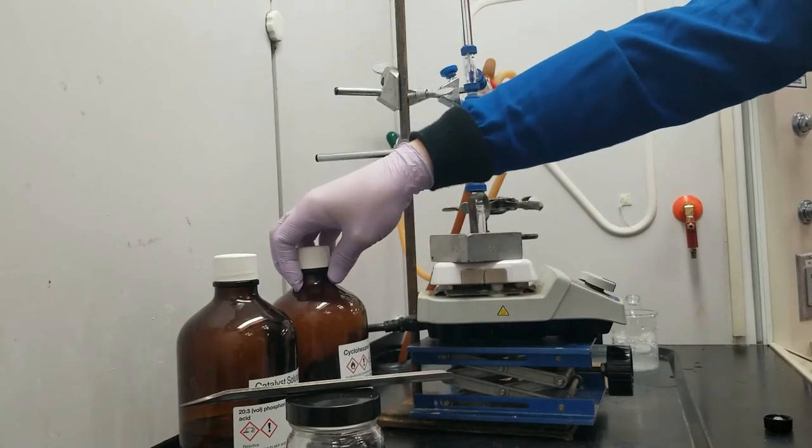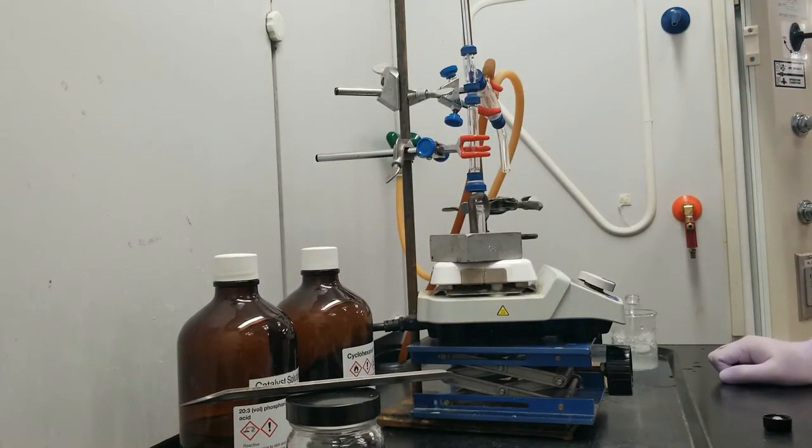The reaction is pretty straightforward, the apparatus that we're going to set up today is pretty fun. It has all of the same components as the distillation that you did a few weeks ago.